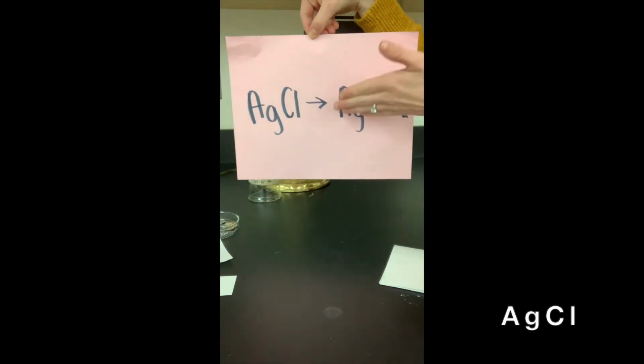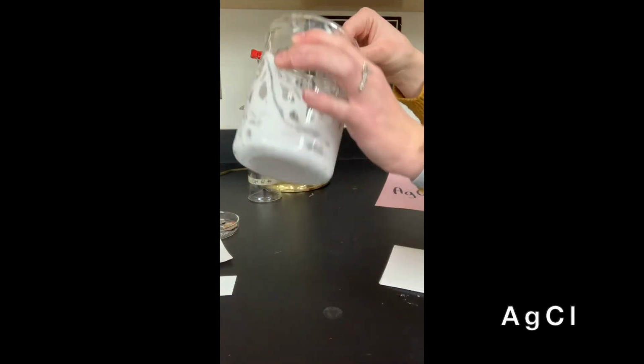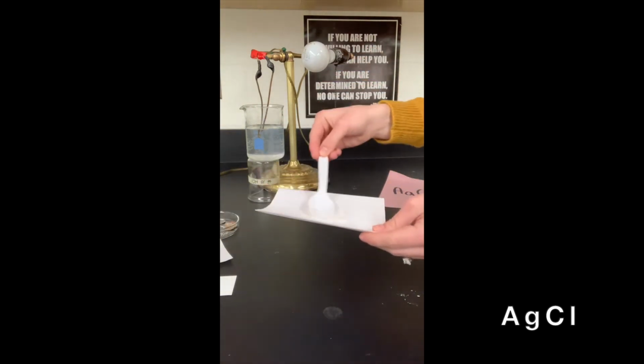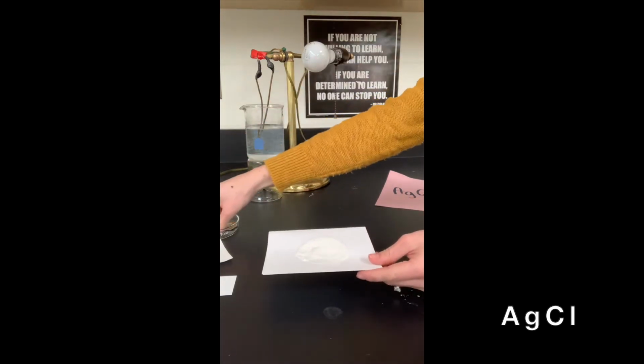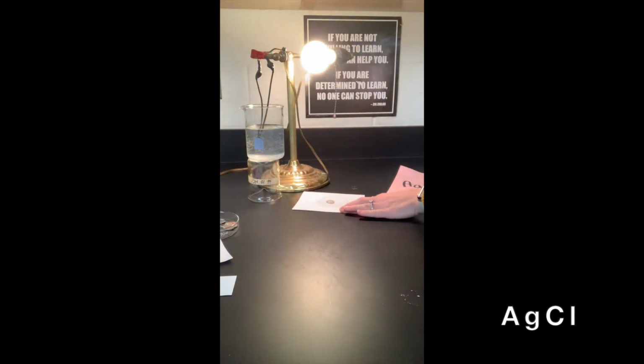Alright, this next one we're going to do AgCl, and we're going to see Ag to Cl2. So what we're going to do is we're going to take this white powder that's in here, we're going to scoop it onto a piece of paper, like this, kind of spread it out. Okay, and then we're going to put a coin in the middle, and we're going to put it underneath this light source for a few minutes, all right? So the light helps the reaction happen faster so we can see it a little bit quicker.